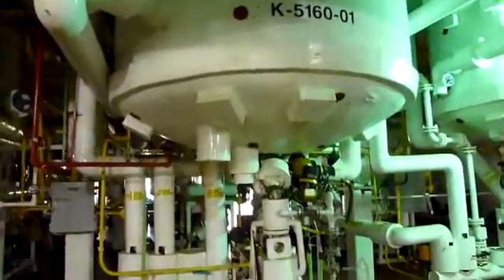When inspecting the bottom of the vessel, look to see that the valves are not corroded. Remove insulation to do so if necessary. You can also pull out an inspection port to look inside at the jacket and see if there is any pitting, rust, or leakage.